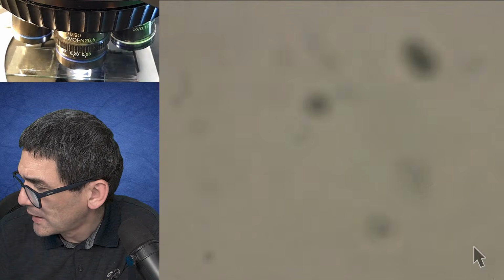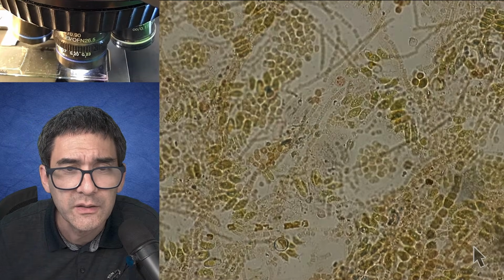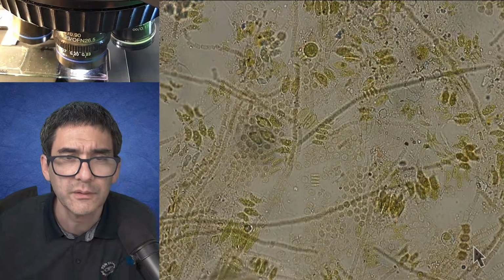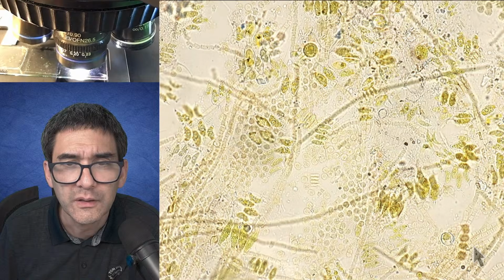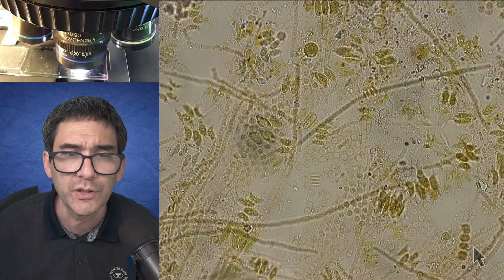And let's now try if I'm able to find it. Now this one here is again glycerin gelatin. And you can see that the contrast is also a little bit different here. So you see that a lot of it, again, is experimentation.